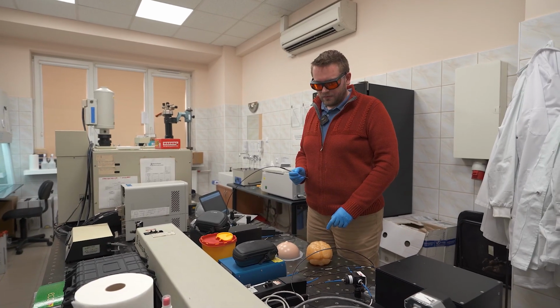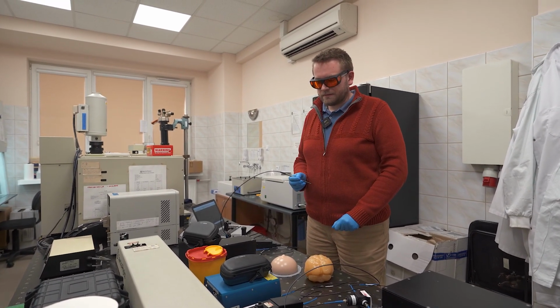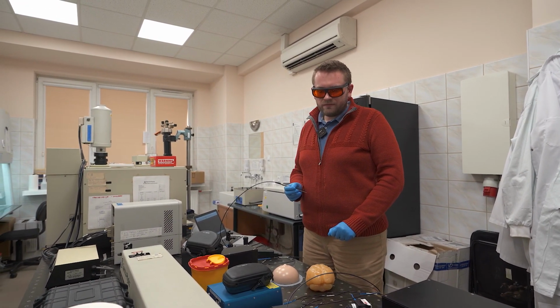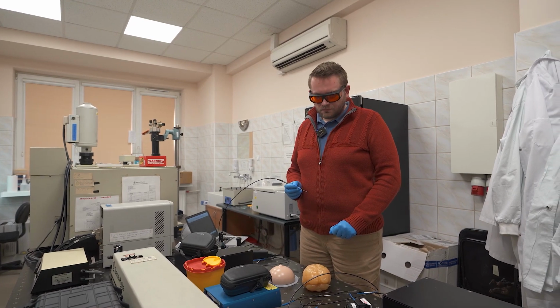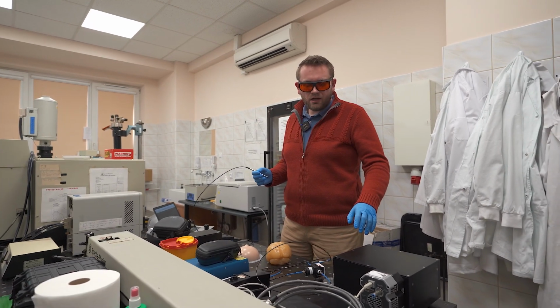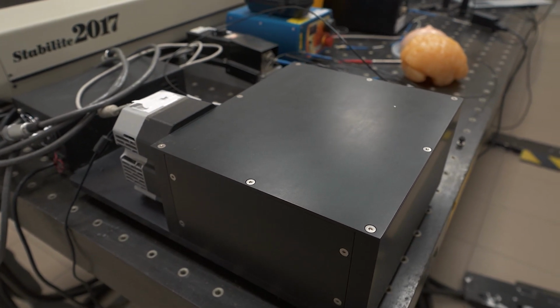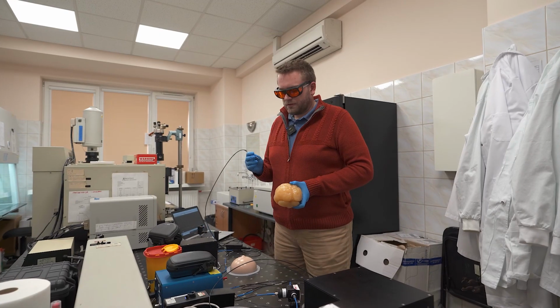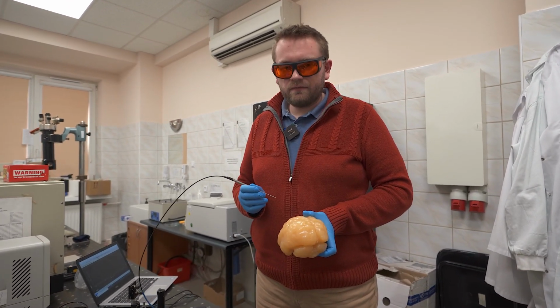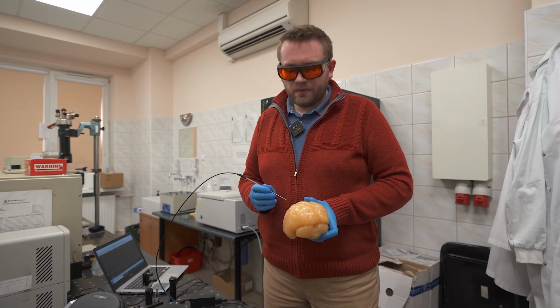Here we have high-performance Raman systems. This system is operating with 3 different excitations, 532, 785 and 671 nanometers. It consists of spectrometers and a very high speed CCD detector. This system allows us, thanks to the hand probe, to collect very high and very fast single Raman spectra.